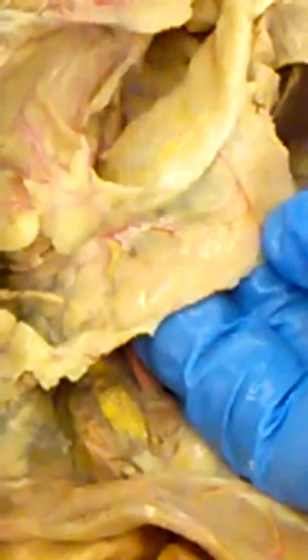The adrenal gland was up here. And the pancreas looks like a big tongue is what the pancreas looks like. That's the spleen. There's the stomach. Not that one. I think this is the pancreas right here. Yeah, that's one. Yep. Okay. So the big thing that looks like a tongue is your spleen. Here's your pancreas.